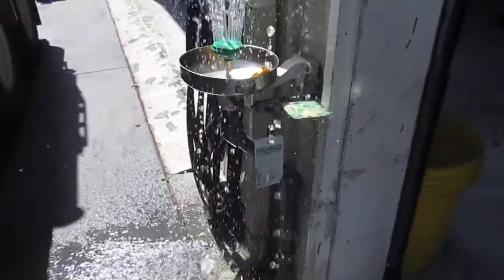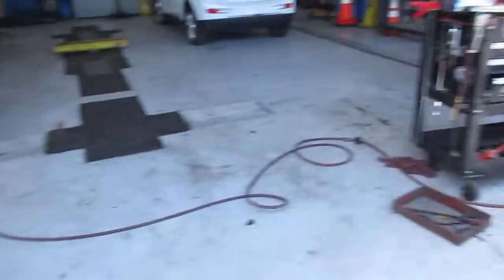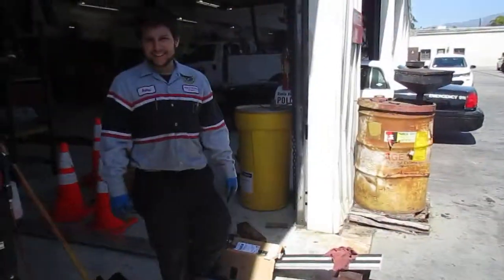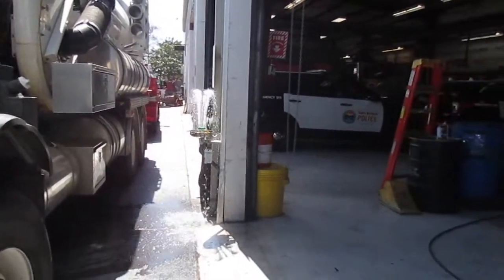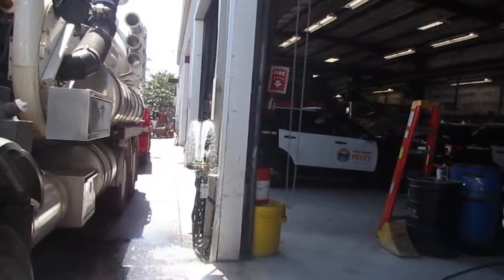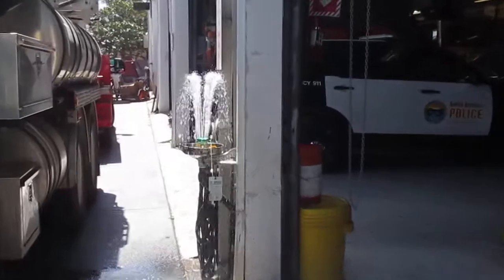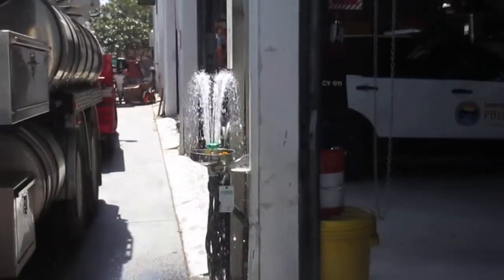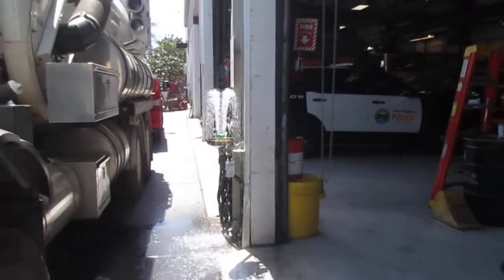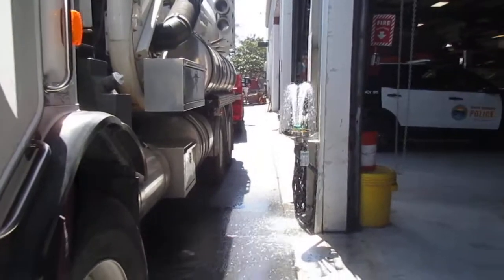Get me wet way back here. All right, so we got a problem, Andrew. All right, what's the problem with this picture here? It's not going into the drain. I didn't notice that. Hang on, let me zoom in. No, no, there's another problem. Poke your eyeballs out. And no, no, not the fountain, it's a truck. The truck, yeah, you can't park a truck by this. I know you didn't do it.